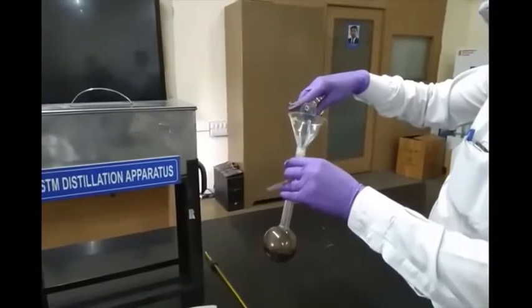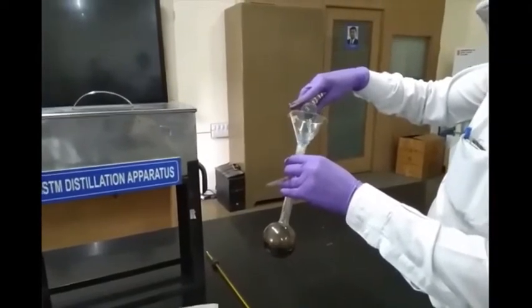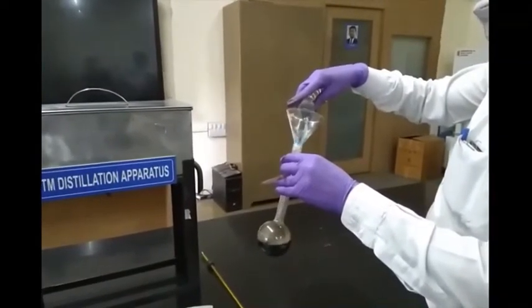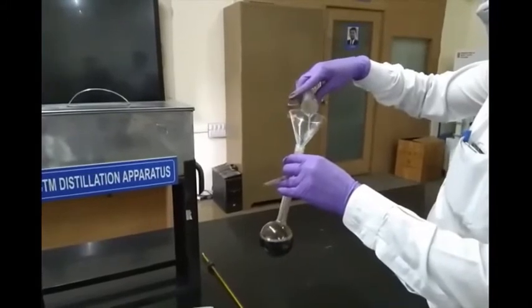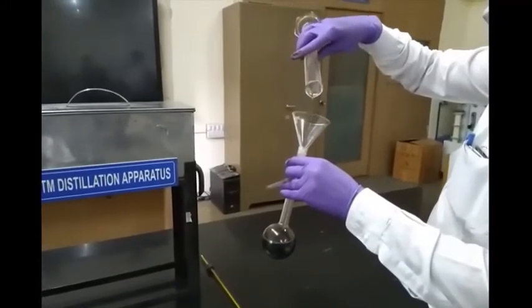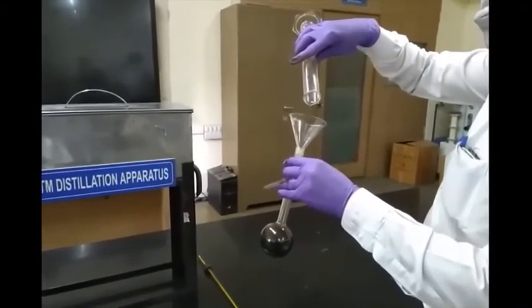Welcome, students. In today's lab session, we'll be doing the practical on ASTM distillation. This test is used to find the boiling range of petroleum fractions.